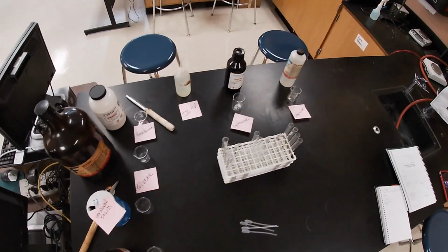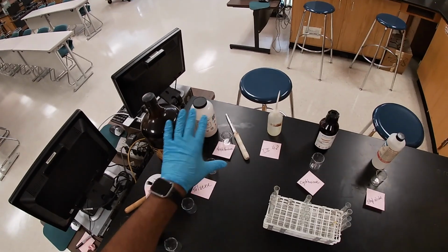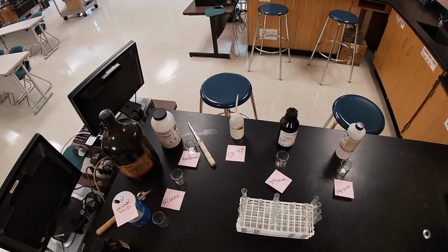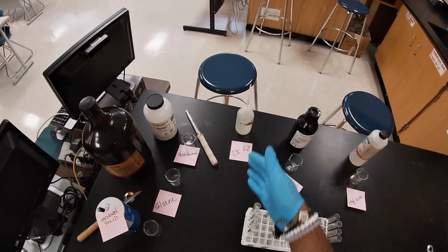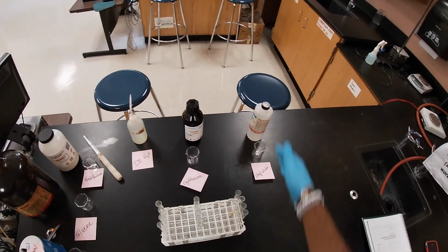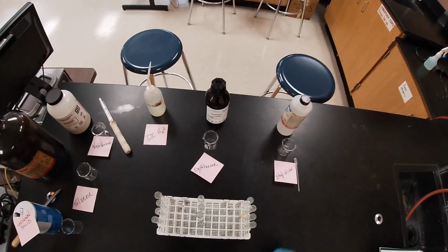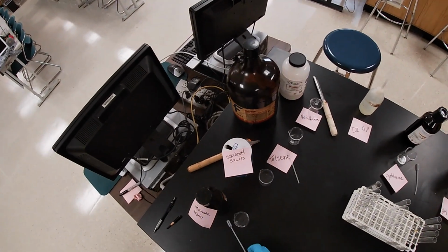And so what I'm going to do is essentially I created a matrix, hopefully you can understand the idea. We're going to use test tubes, and we're going to fill this group of test tubes with deionized water, this group of test tubes right here with cyclohexane, and then my last column, we're going to fill with ethyl alcohol. We're going to be using pipettes for our liquids, and here it is.